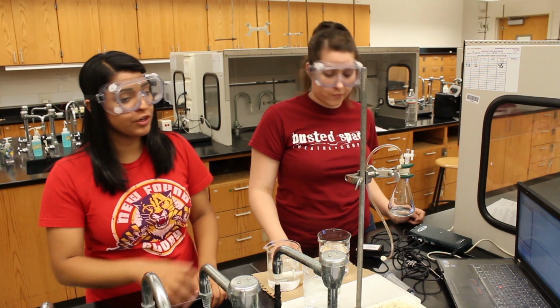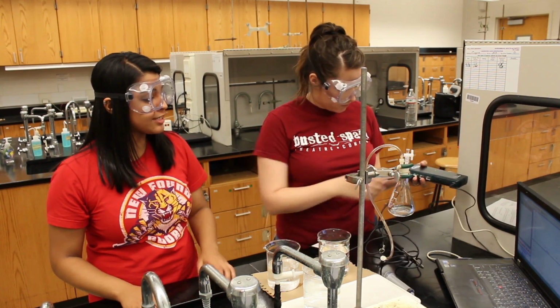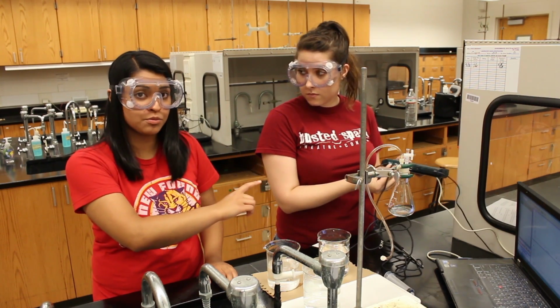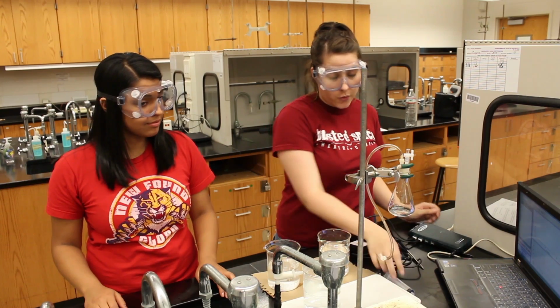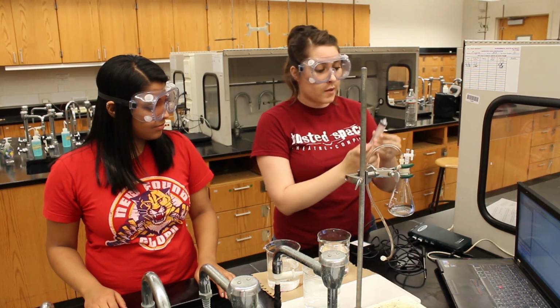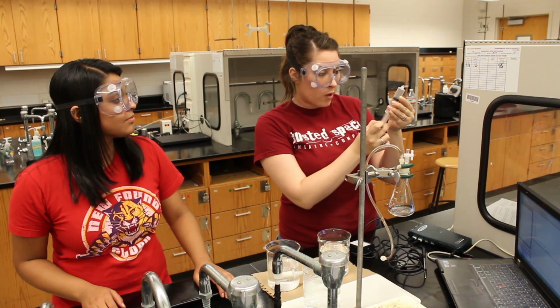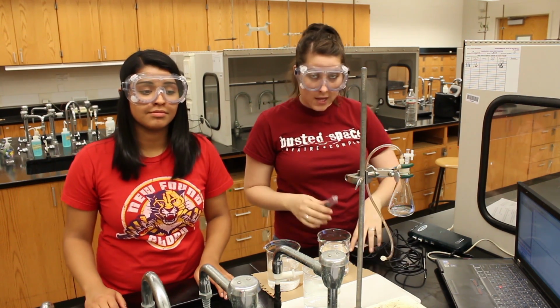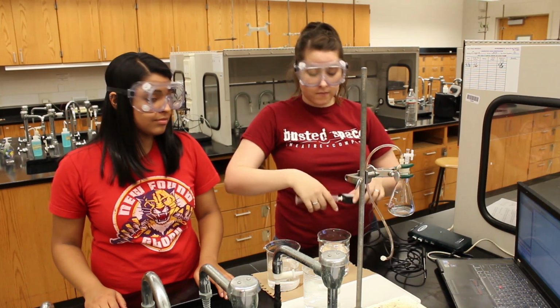First, you'll be going through the Vernier Lab Pro equipment again. You want to be sure that the pressure sensor is connected to channel 1 and that the temperature probe is connected to channel 2. Now, before you connect your syringe to the pressure sensor, you want to make sure that the edge of the rubber stopper is at 10 milliliters. Once you've set your initial volume, you want to attach it to the pressure sensor. Basically, you just twist it on.